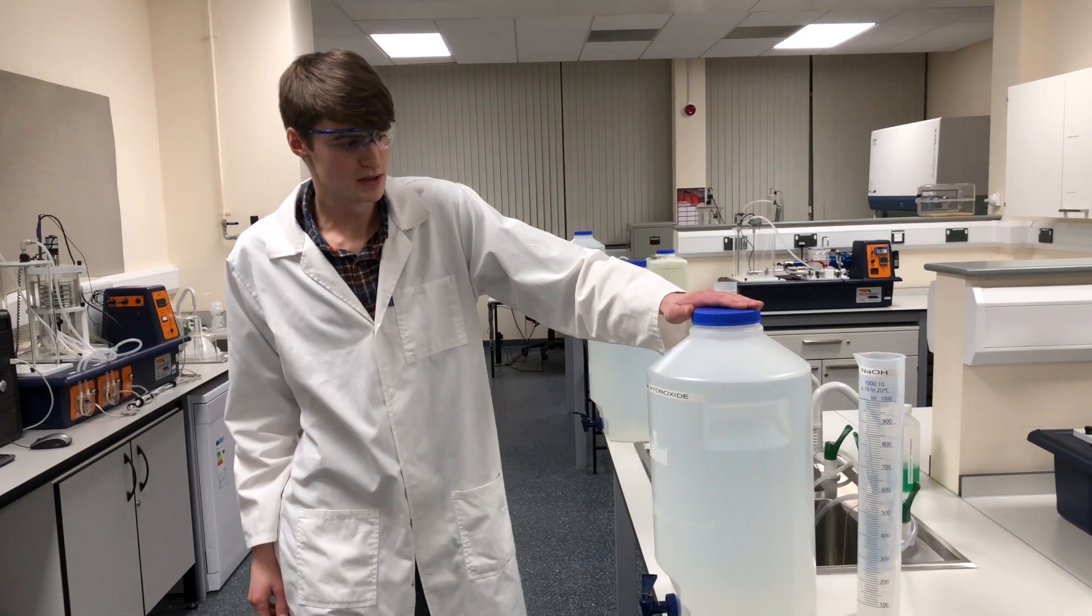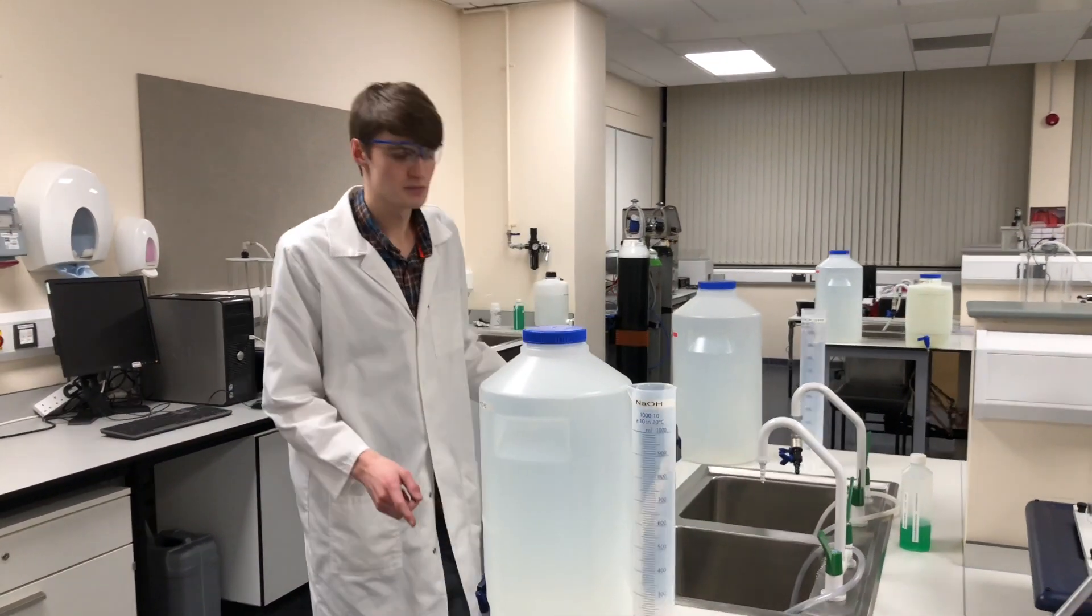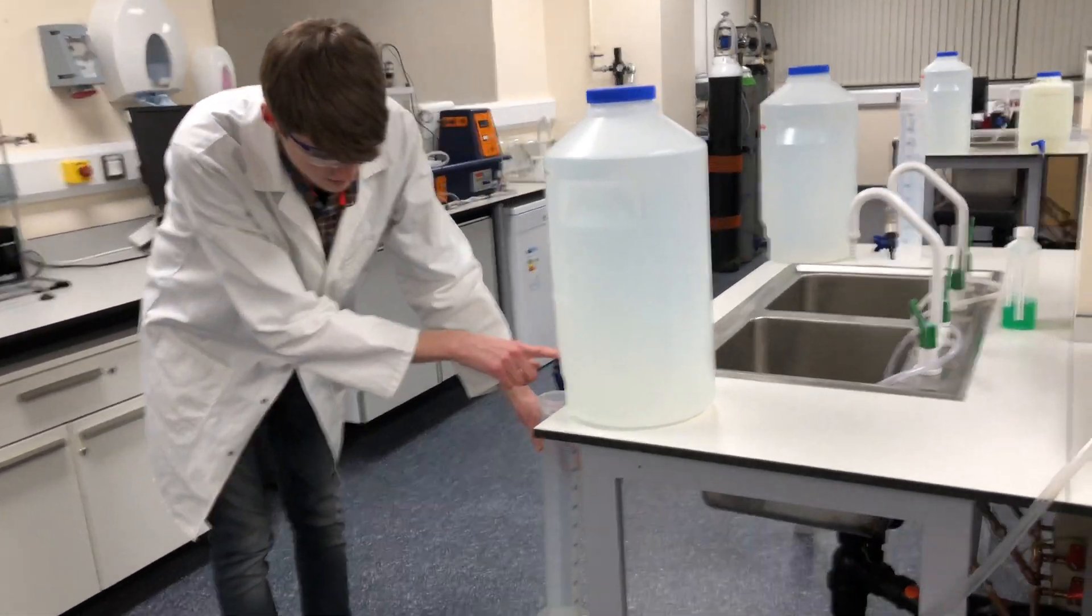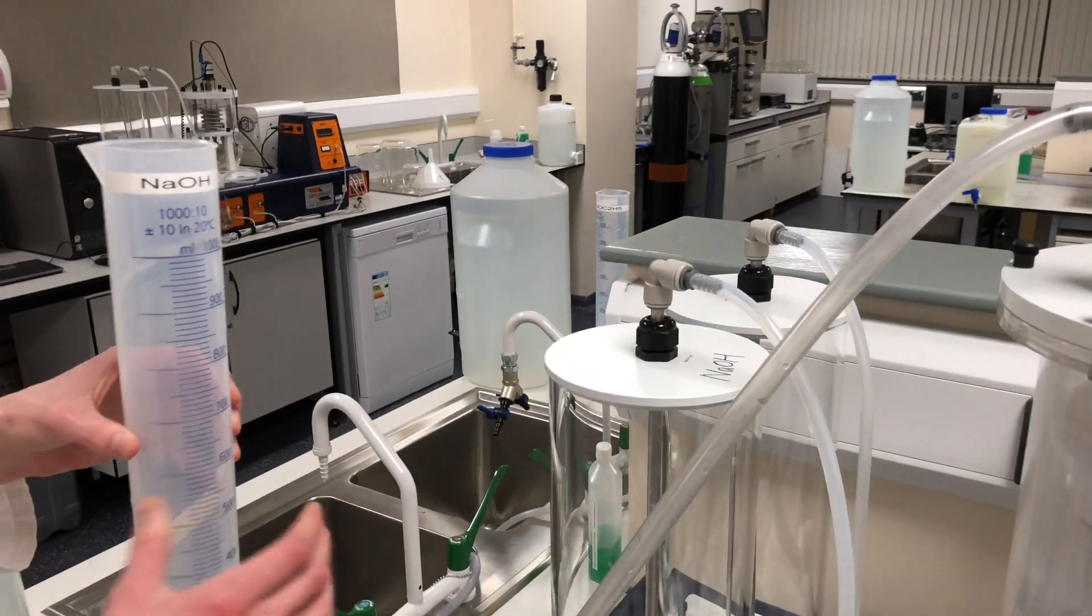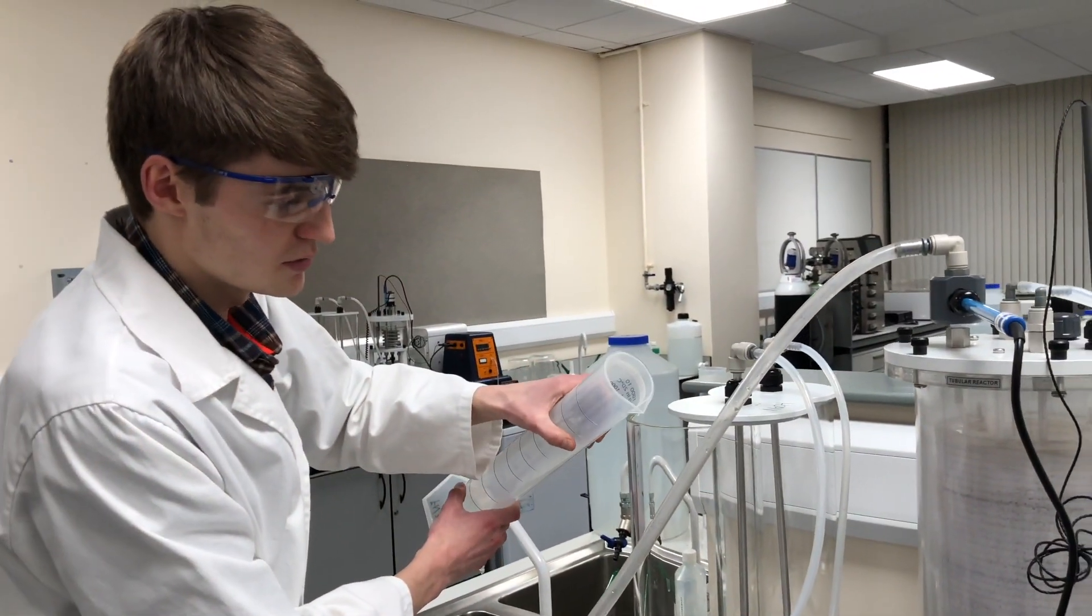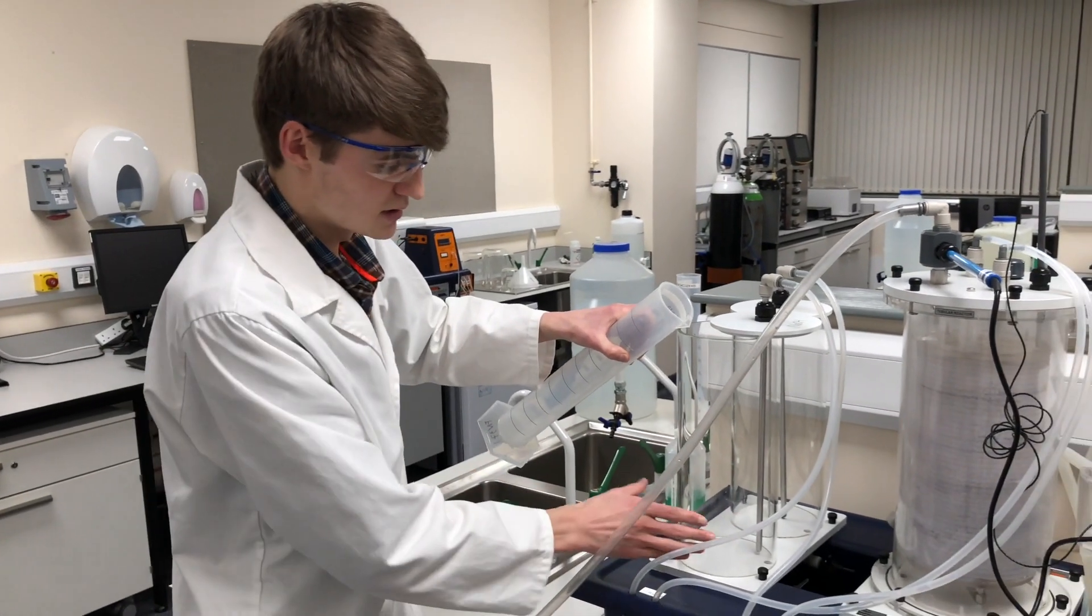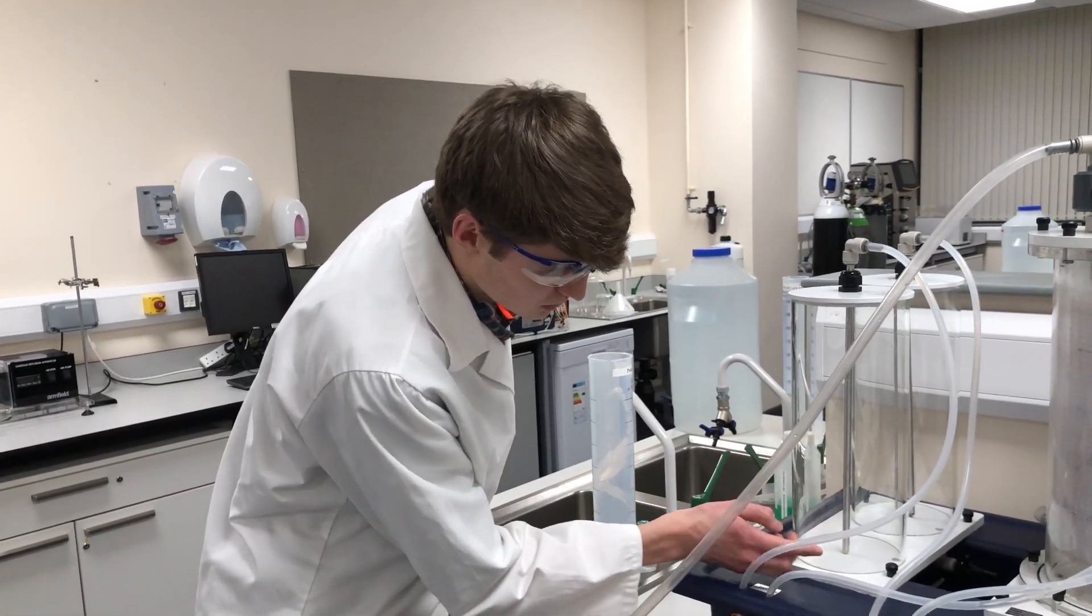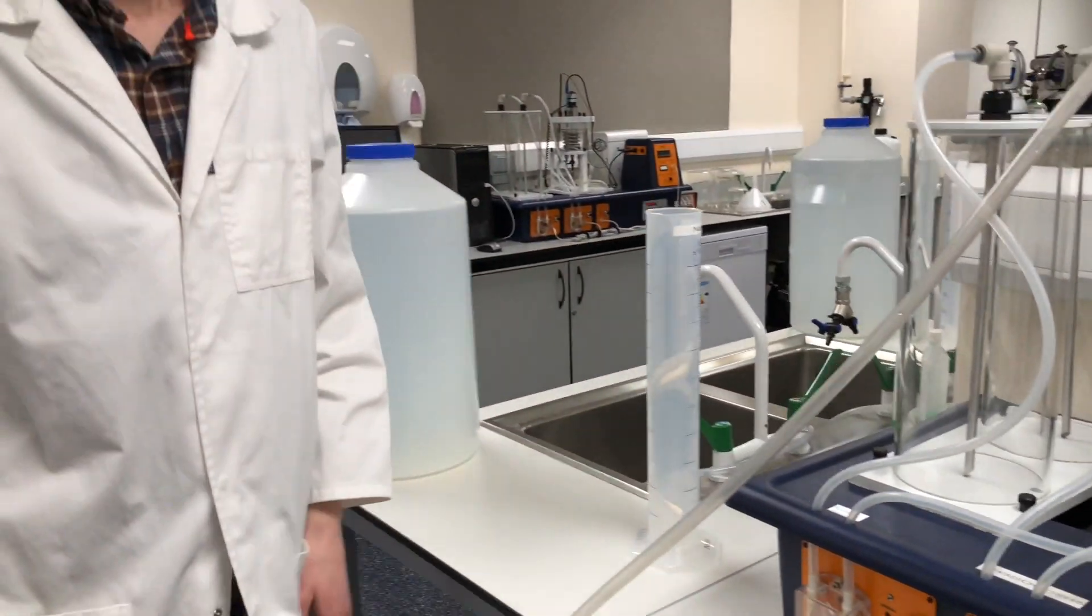Ethyl acetate and sodium hydroxide come with their labeled sodium hydroxide and ethyl acetate measuring cylinders. These you want to make sure you don't mix up, because obviously if you mix them up, you're starting the reaction within the measuring cylinder, and it will spoil the results. So all you need to do is just fill up from the top here. With this full of sodium hydroxide, there are two labeled tanks, sodium hydroxide and ethyl acetate. How do you fill them up? You just gently lift this up and slide it across, leaving a gap, and you simply pour in with trying to minimize any splashing or agitation to the solution. And you want to make sure that as the tanks deplete, as the reaction goes on, that the solution does not fall below the actual T-piece here. In other words, you're going to be taking in air and not actually solution. So as long as that's fully submerged continuously, you should be good to go.